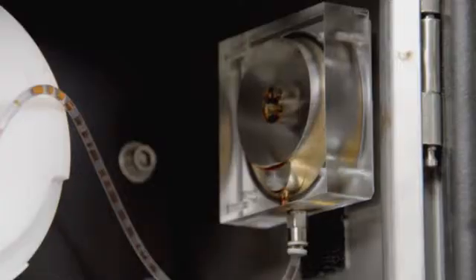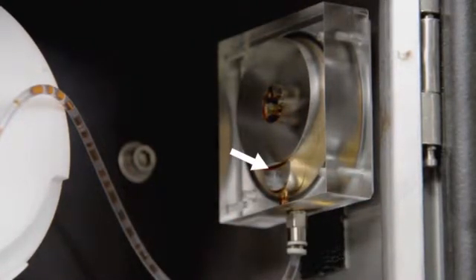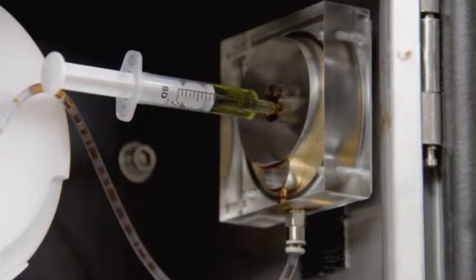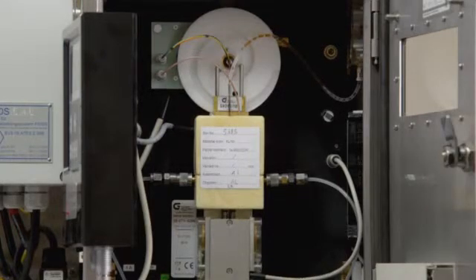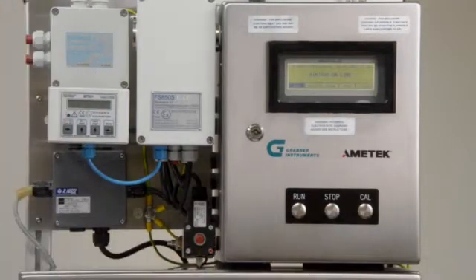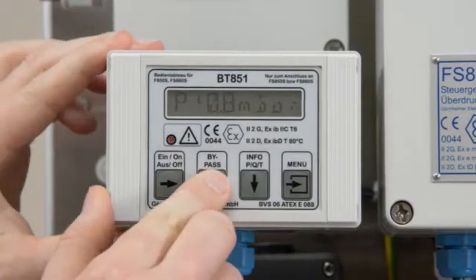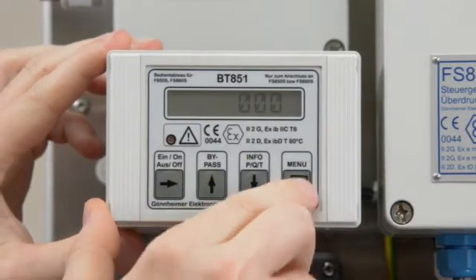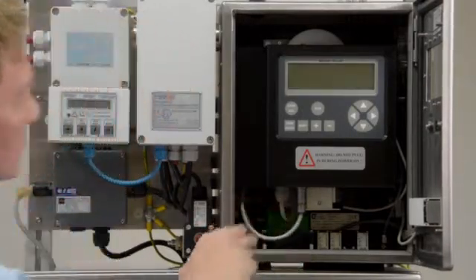Simple Maintenance Steps. Check the oil lubrication reservoir every 10,000 runs. The bottom chamber of the reservoir should be filled with oil. If it is not completely filled, add 0.5 to 1 milliliter of oil into the reservoir. You may exchange cells between different analyzers — no calibration is required on a new cell. To change the cell, press Stop and wait a few seconds until the analyzer reaches its starting position. Then activate Bypass mode on the purge control.